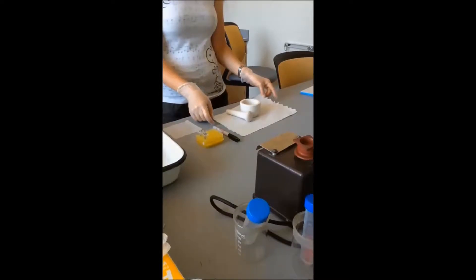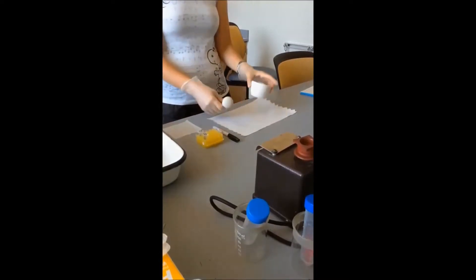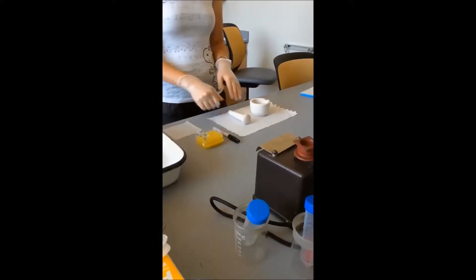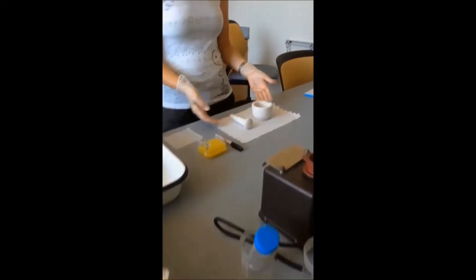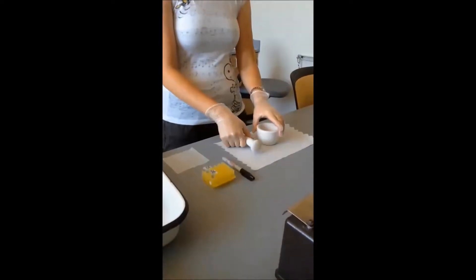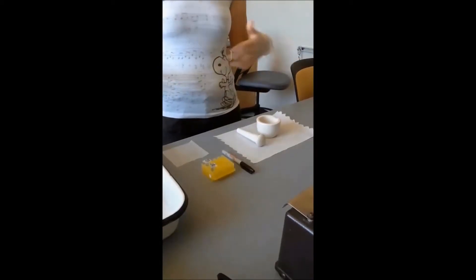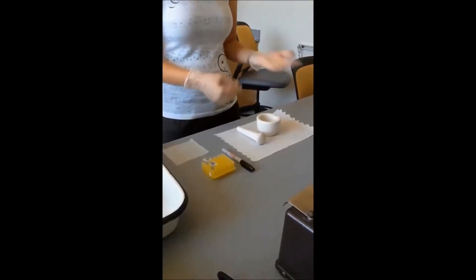You'll notice I put down a paper towel underneath our clean mortar and pestle that we'll be using today. We'll be using liquid nitrogen. There will be some spillage unfortunately, as careful as we will be, to help prevent contamination between grindings.